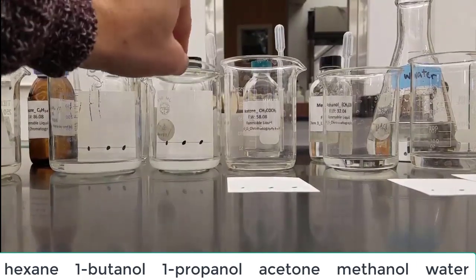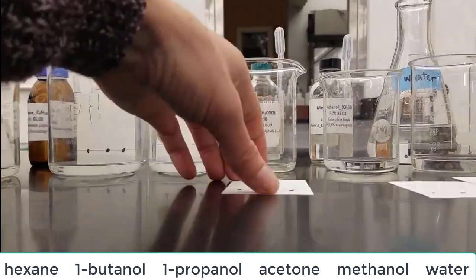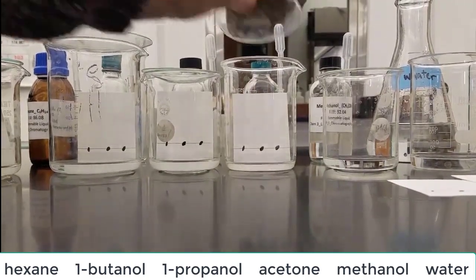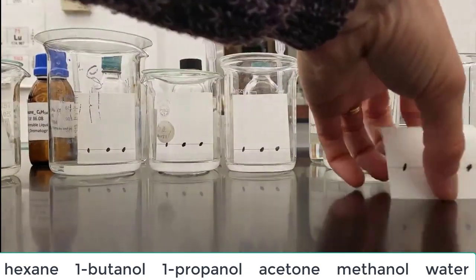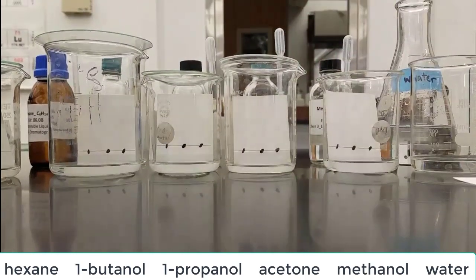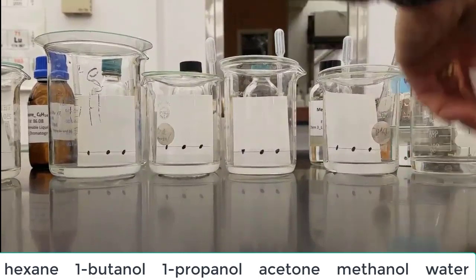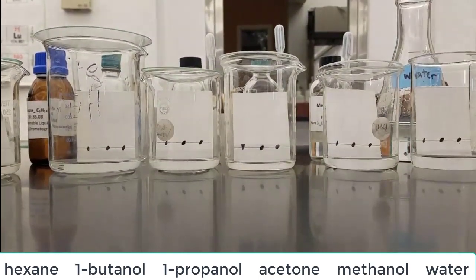Next one is propanol. Next one is acetone. Next one is methanol. Last one is water.